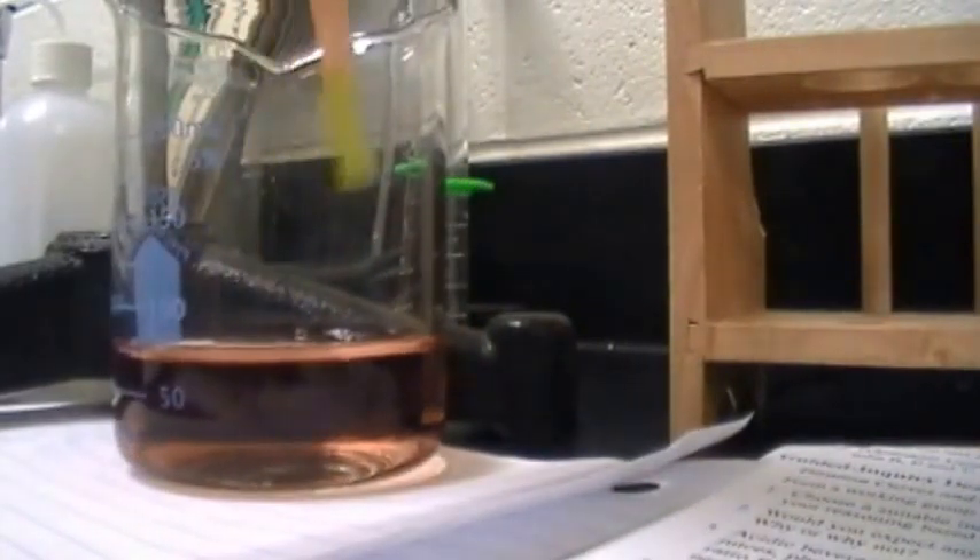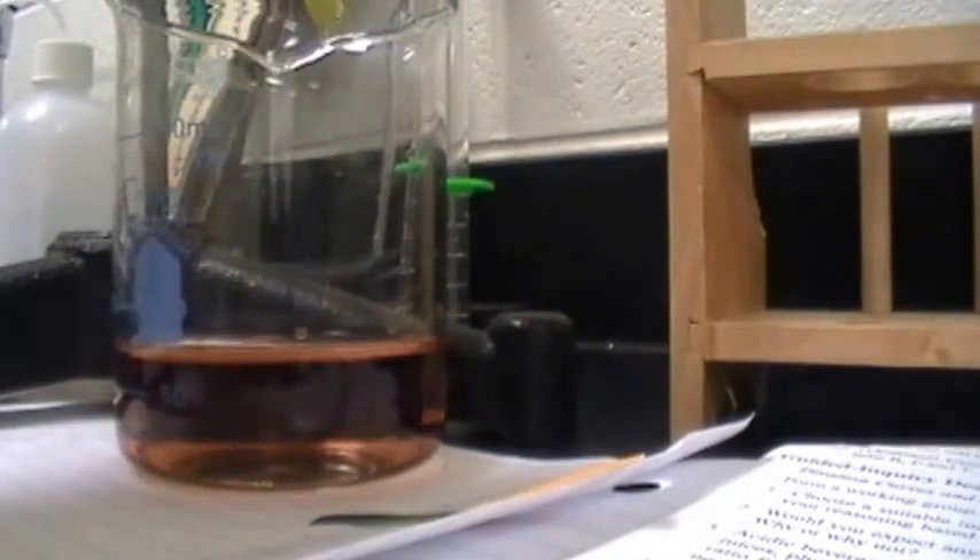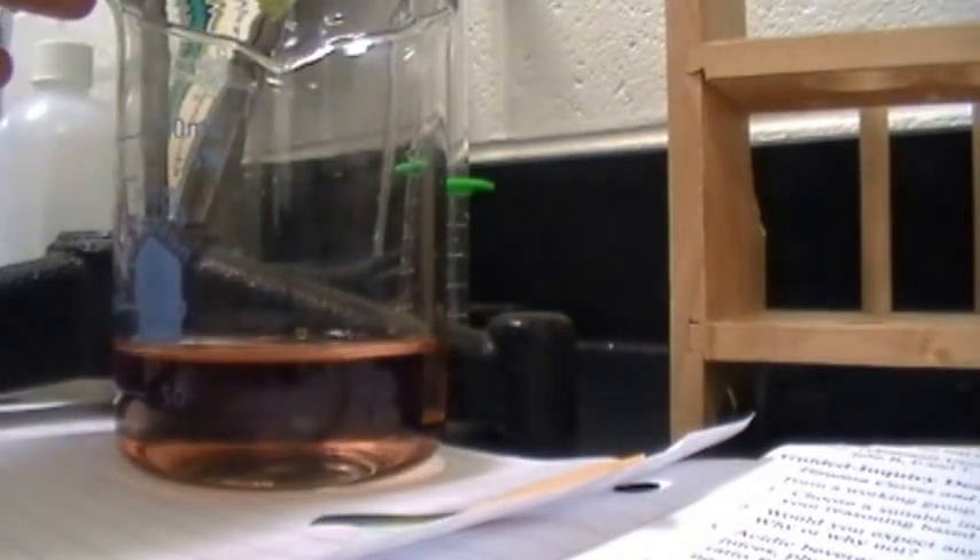The pH is past eight — I would say it's around eight now. Look, it's purple! It's 24. Except this is our 14th drop. Now ours didn't start until milliliter 12.